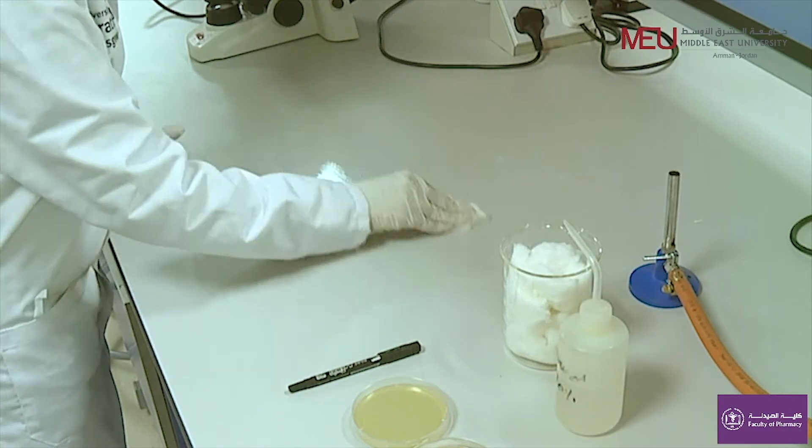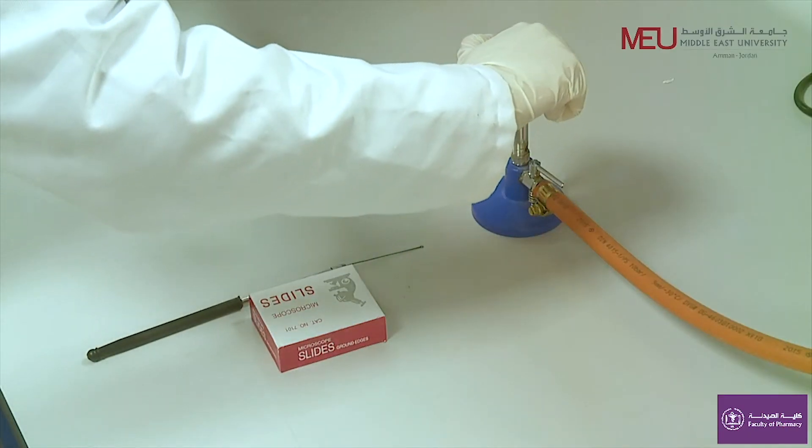Before you start, remember to wash your hands and disinfect your working area and open the Bunsen burner.